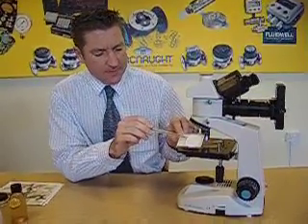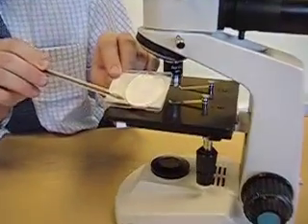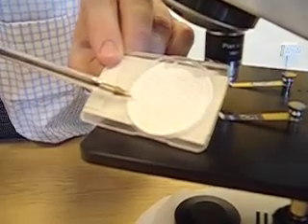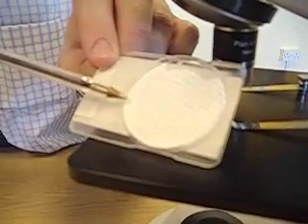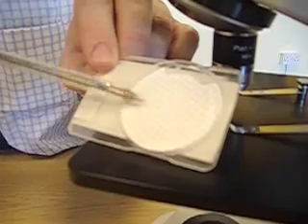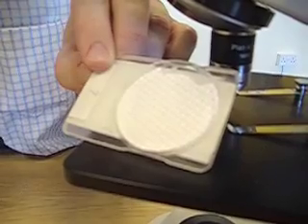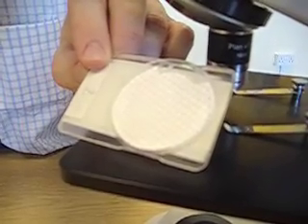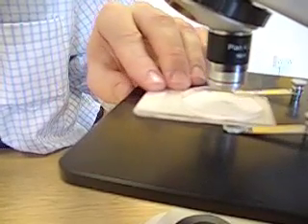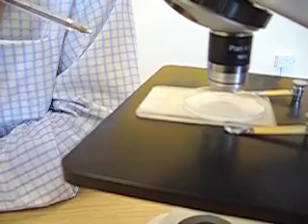This is a patch test slide here. As you can see, it's a very thin membrane which has got grid lines drawn on it. What we do is under vacuum, we pull a sample through the patch, and it leaves us with all of the production impurities and all the contamination still present in the sample on the top of the slide. We then analyze that slide under the microscope, and we'll be able to see exactly what's in there. Usually magnification is run at about 300 times.